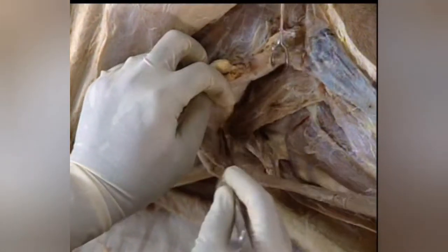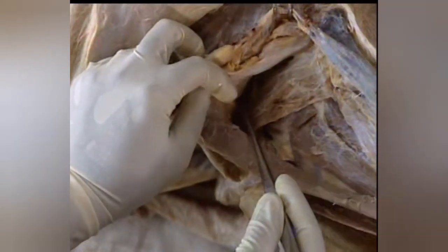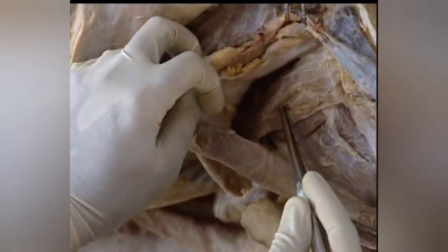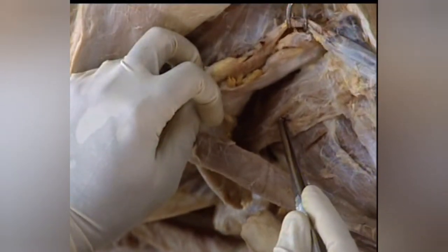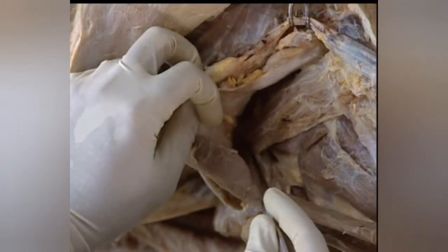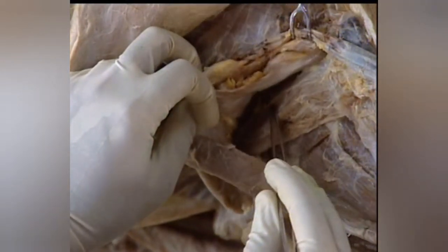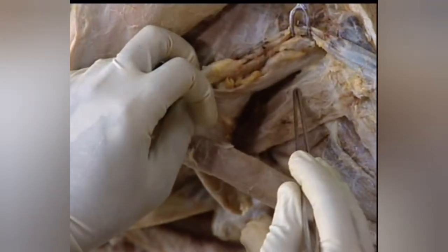Omohyoideus is a thin, elongated muscle originating from the cervical vertebrae and inserting to the hyoid bone.